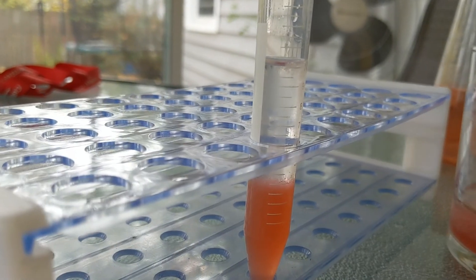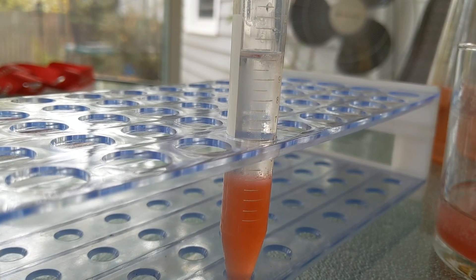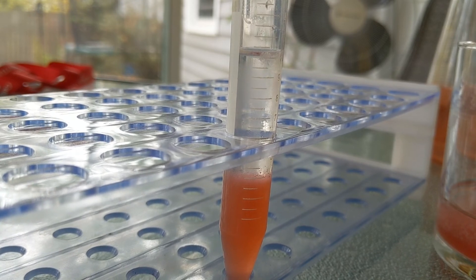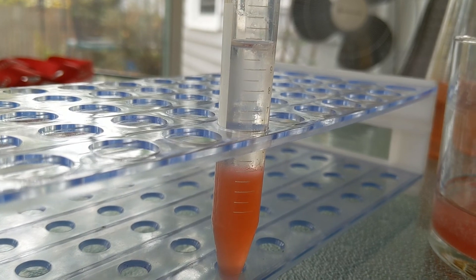If you're doing this in class, keep your little test tube. You don't want to jostle it though, because if you do, you're going to disrupt it if you shake it up and you'll lose the DNA. It'll go back into solution. But you can always make more. It's so easy. You could make it every day if you wanted to.